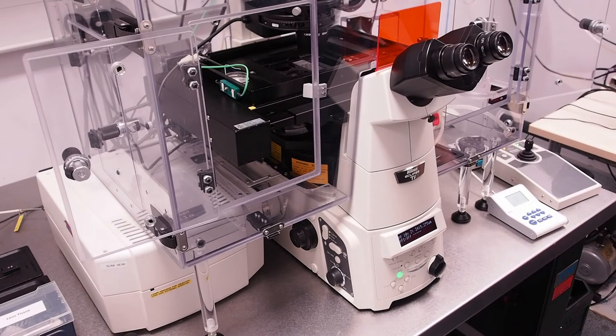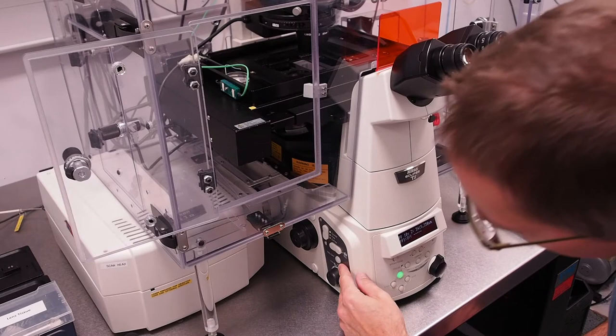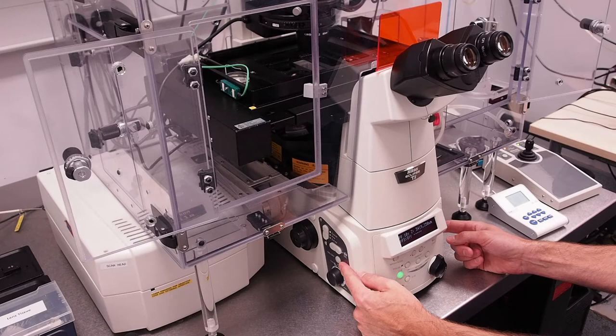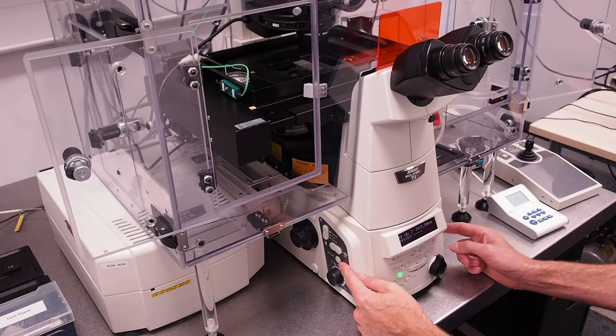To find our sample using bright field on the left of the microscope body there is a transmitted lamp on off button and on the right there are two buttons labelled escape and refocus. Firstly press escape to bring the objective to a known position and then once it has finished moving press refocus to move the objective back to approximately the focal plane.